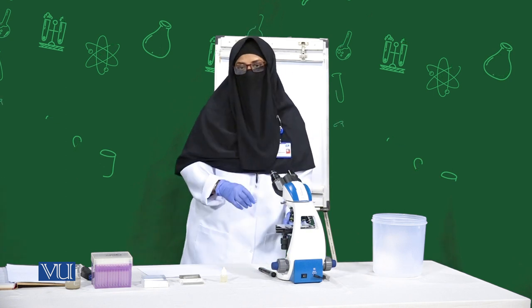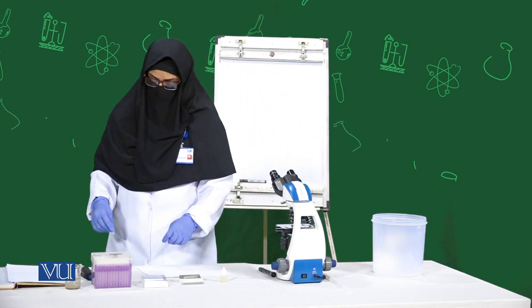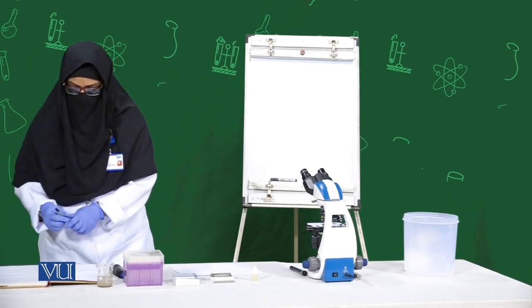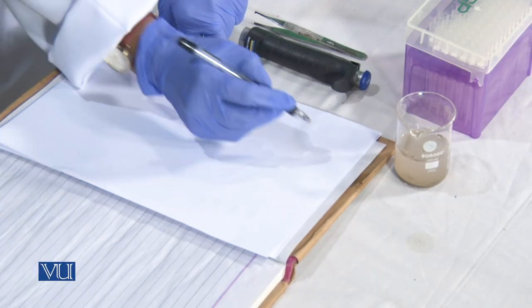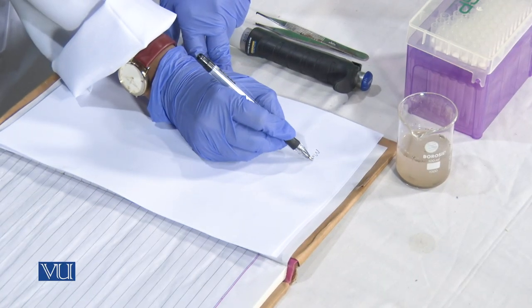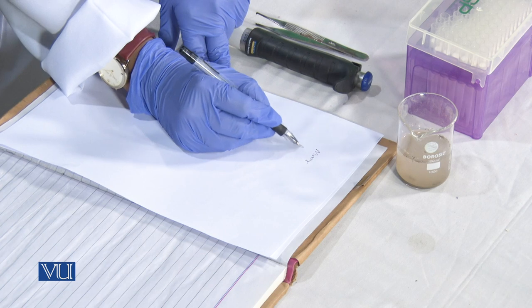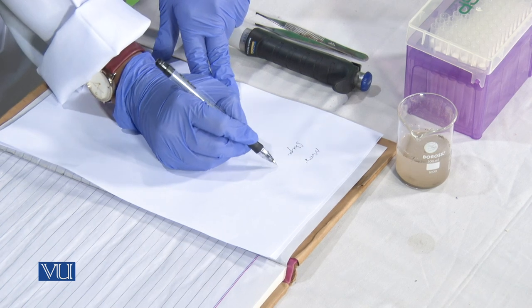We will record our observations in our data book and practical copy, whether the organism was moving, what was the shape of organisms.